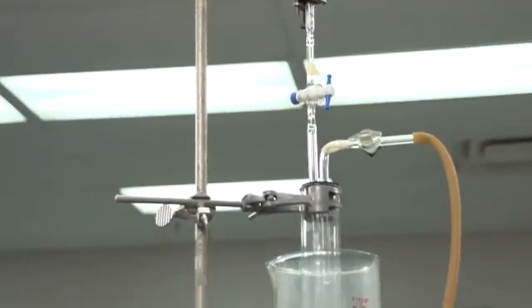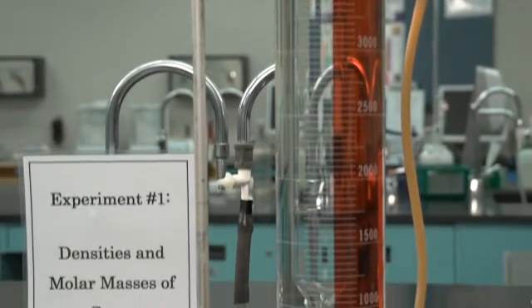Repeat the process until there are three runs that are within 0.2 seconds of one another.